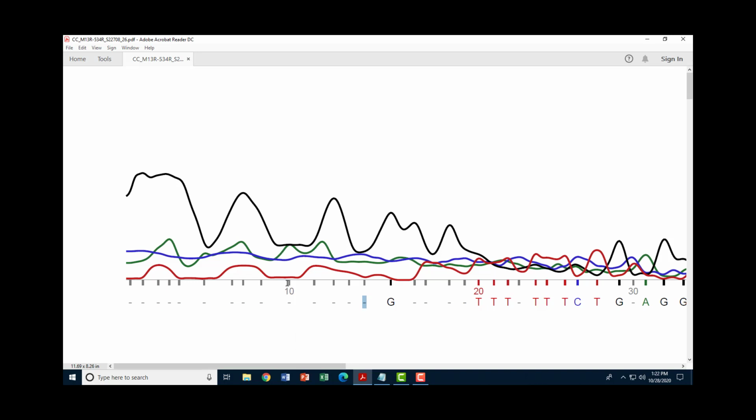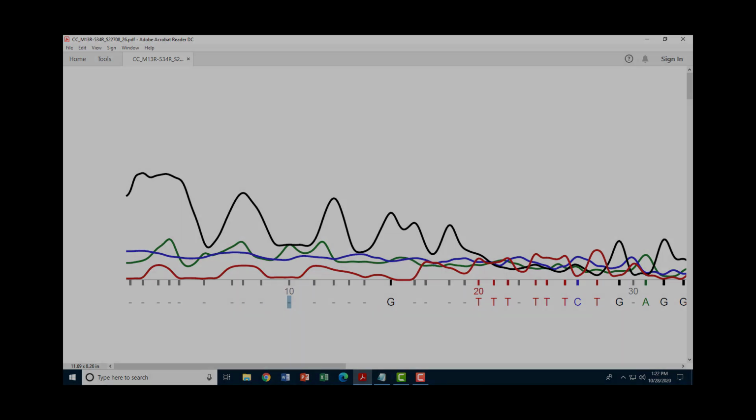Like for example here at position 10, I've got almost no signal for thymine. I've got a flat cytosine signal with a little bit of a dip. There is an upslope here on the adenine signal, and I've got a flat signal on guanine. Even though it's matching the adenine signal, that's flat, but this is on the upslope. So I would probably call this A for adenine. So you can go through, plug in these values into your trace as best you can figure out, and see if that improves your blast score.